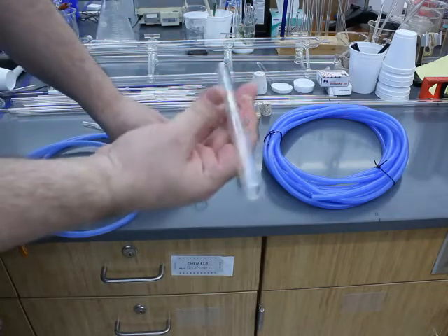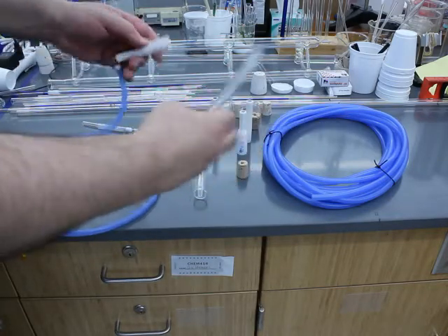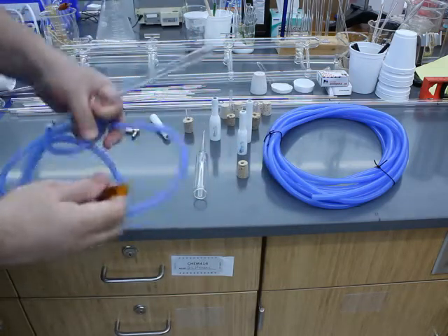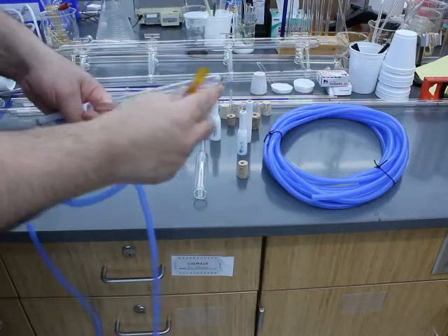I've got 14 millimeter tubing. I can just slip it on like that and I'm ready to go. And once you've attached it, there's your blow hose. You put that in your mouth and you blow.